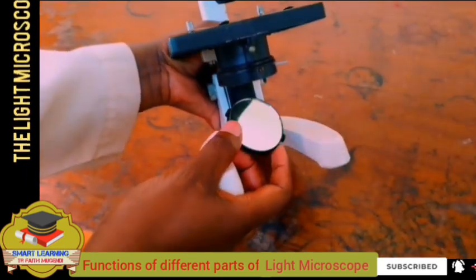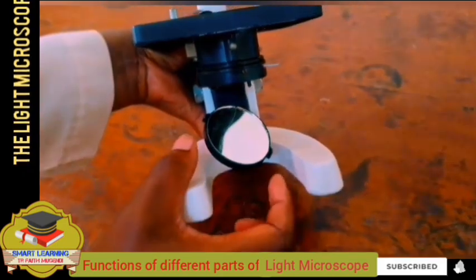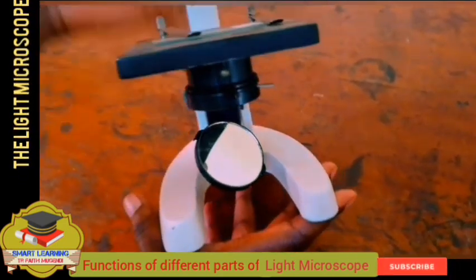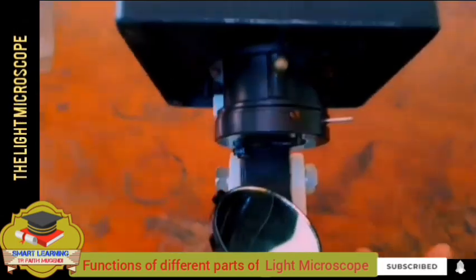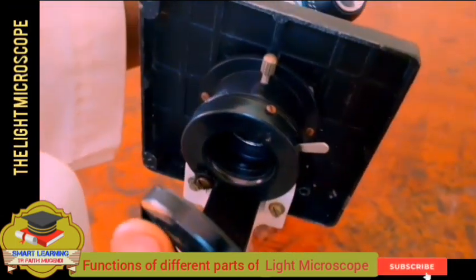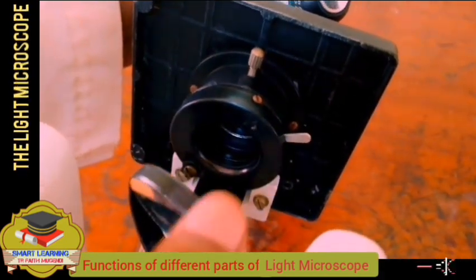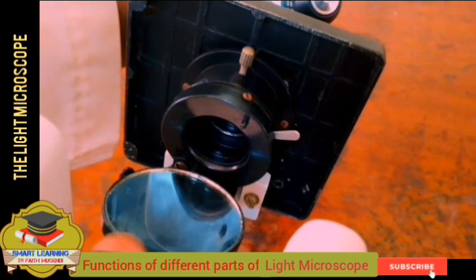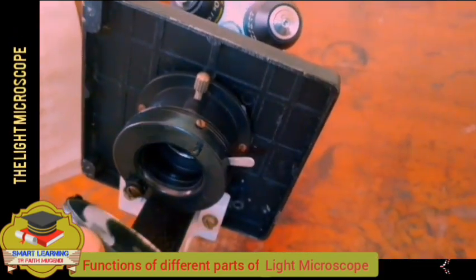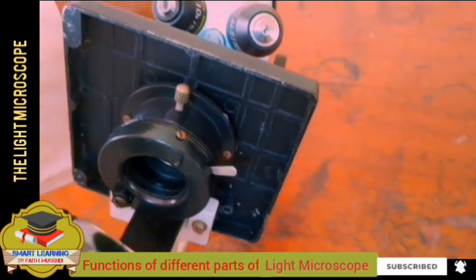We want to start with the mirror, and the work of the mirror, as we all know, is for reflection. The reason we have a mirror in the light microscope is for directing light inside the microscope. You can see it is reflecting light in and off. So you set the mirror in a way that it directs the light inside the microscope.